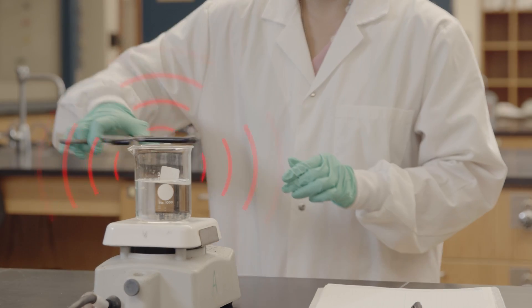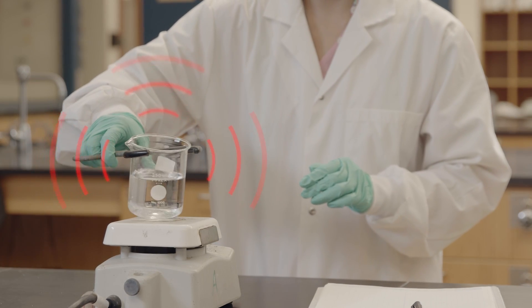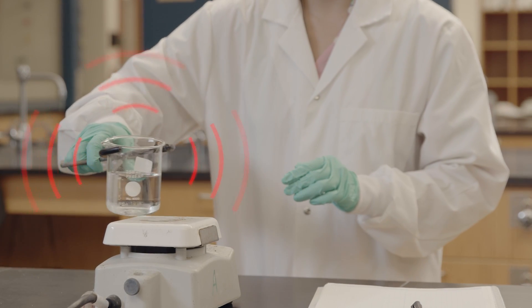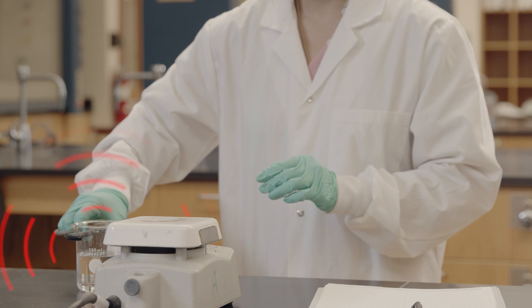In some experiments, it may be the procedure that is hazardous. If a solution needs to be heated, the source of heat creates the hazard. This is especially true if one of the chemical reagents is flammable.